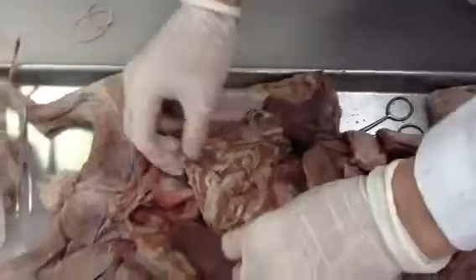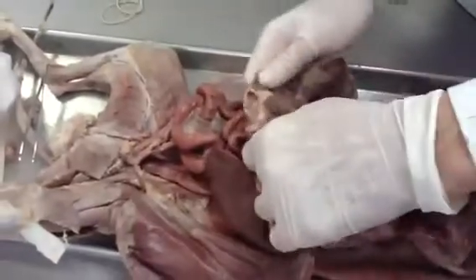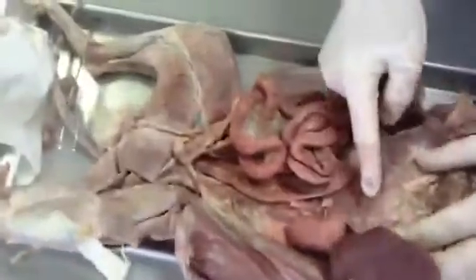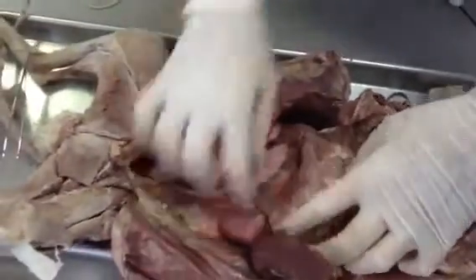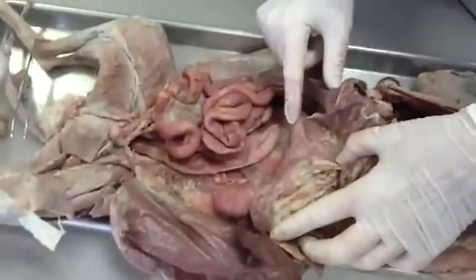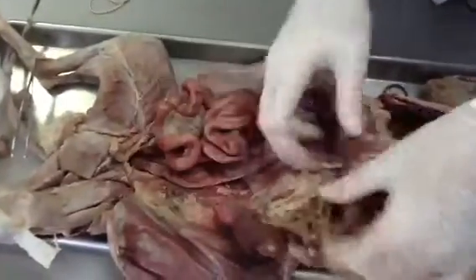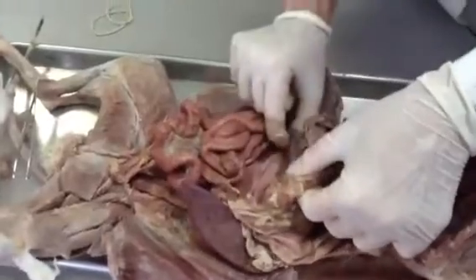small intestine. In order to find the pancreas, you have to find where the stomach is and where it enters the small intestine, and I don't want to remove this for tomorrow's practical exam. There it is. There's going to be a light pink glandular-looking tissue right here. This is the pancreas, the head of the pancreas, and the tail of the pancreas coming all the way down here. It's stuck into the tissue just below the stomach and going all the way over to the small intestine.